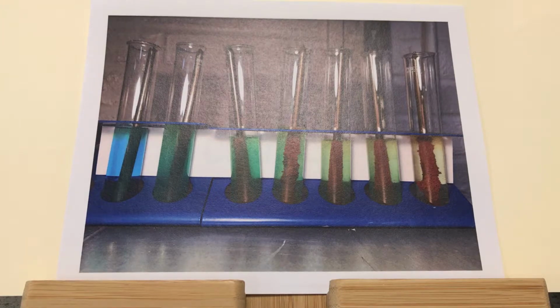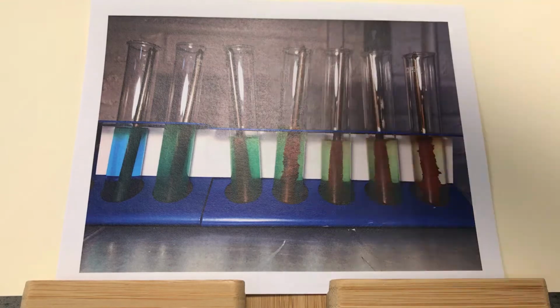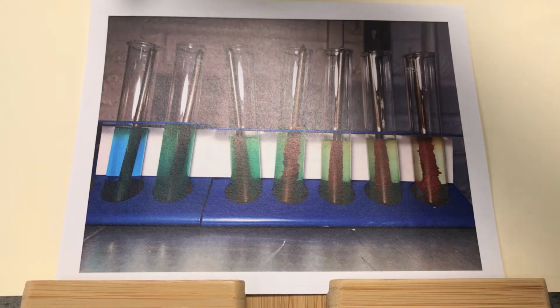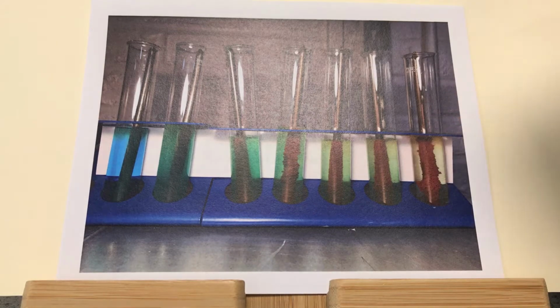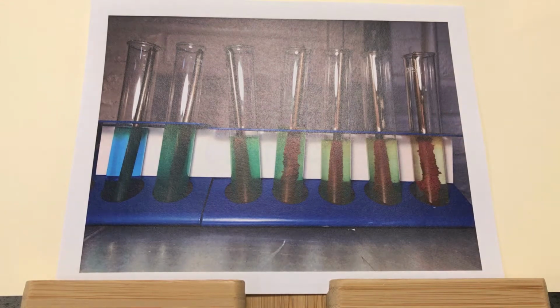Okay, so we can see every hour I set up a new experiment. So this was 7 hours old, 6 hours, 5 hours, so on. And you can see that kind of transitional colour change as the reaction is taking place. So we started off just here with copper sulfate and the iron nail, and we end up here with copper extracted on this surface of the nail with iron sulfate solution, which is a different colour because of the iron.